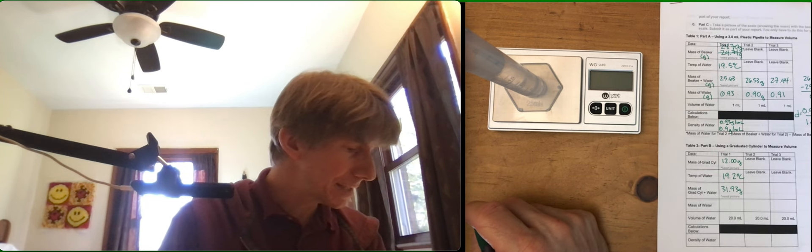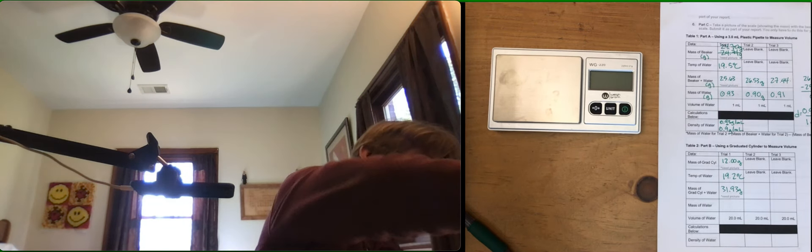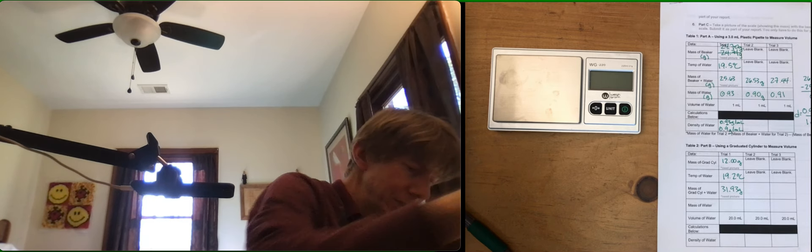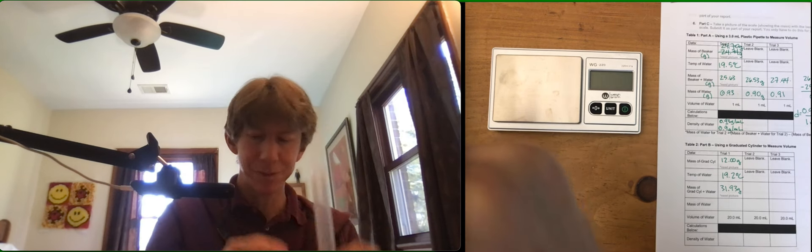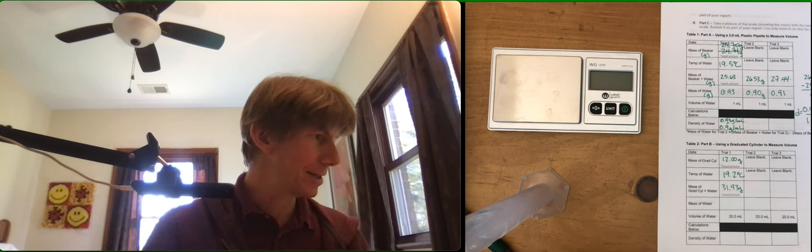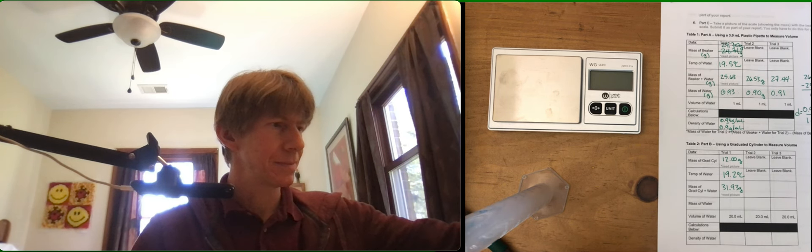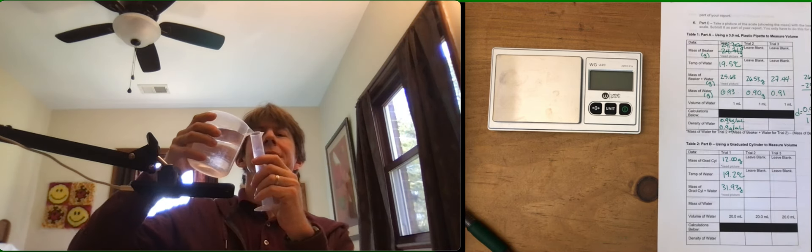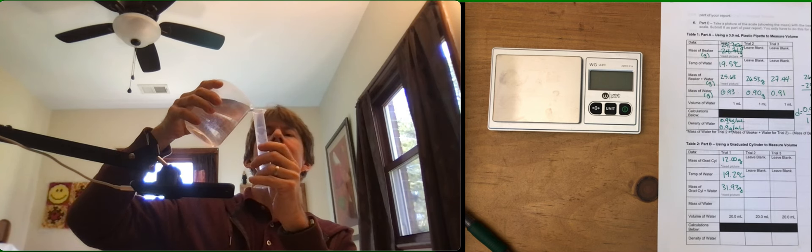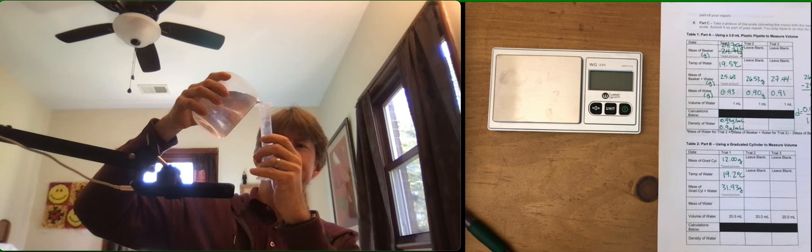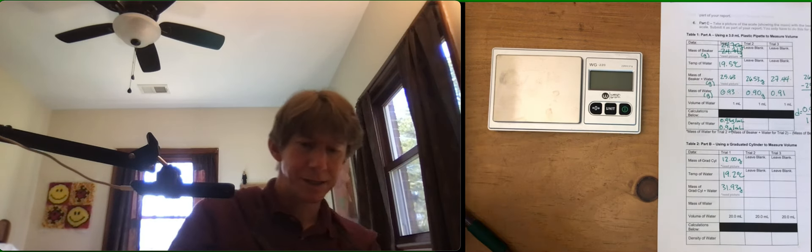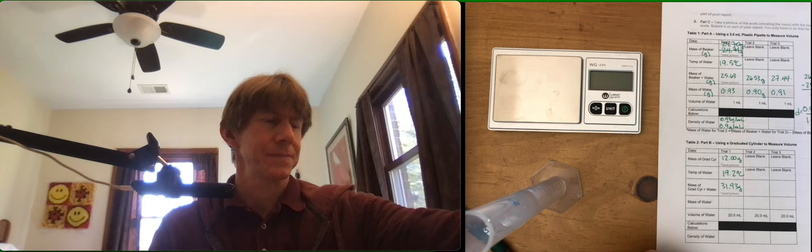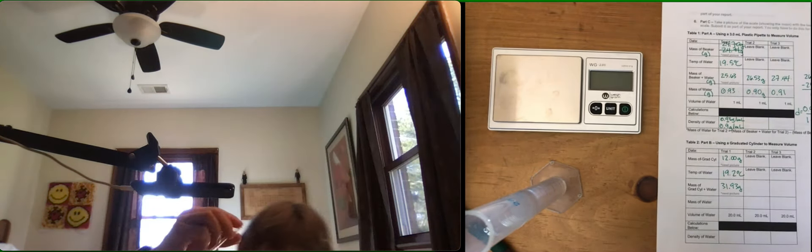Empty out your graduated cylinder and carefully measure out another 20 milliliters. Don't re-weigh it. No need to re-weigh the empty graduated cylinder because it's not empty anymore. It still has a tiny bit of water in it. That's why these say leave blank. Pour my water in again. One thing you should know about me is I have no depth perception. That's too much. I'm going to get down to my 20.